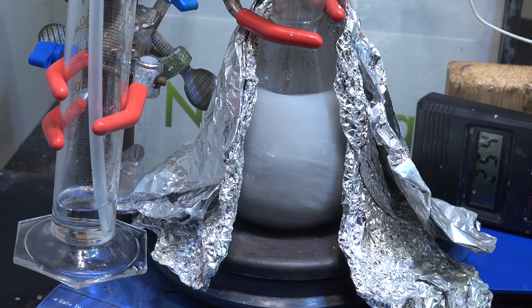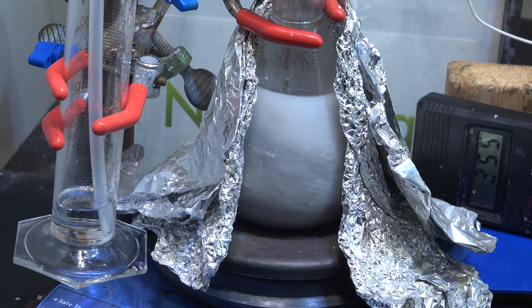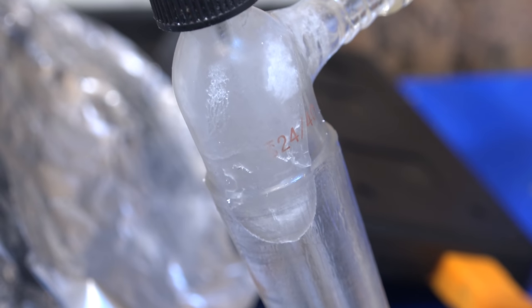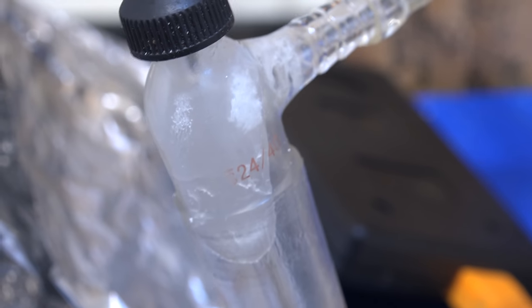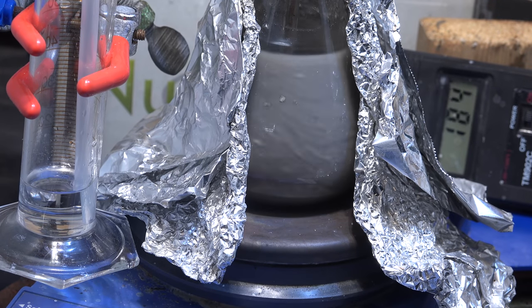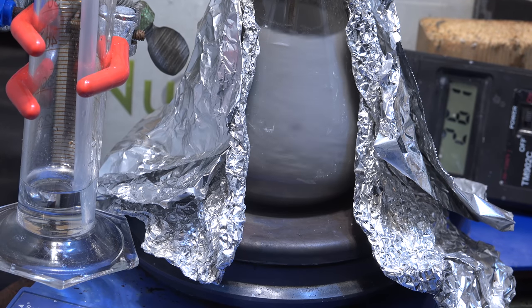Unfortunately, this reaction is extremely slow. The bubbles only come once every 30 seconds, which is almost negligible. Even after 7 days of heating, I still wasn't able to see any appreciable lithium formation. At first I thought it might be because my borneol was boiling out and solidifying in the upper parts of the apparatus at these temperatures. So I repeated the experiment again, this time using tetrahydrolinalool, which is liquid and will just drip back down.